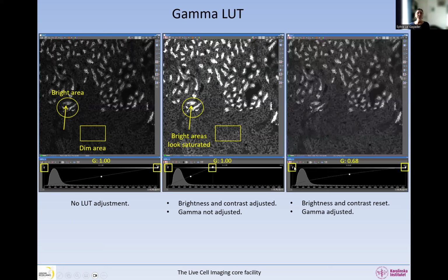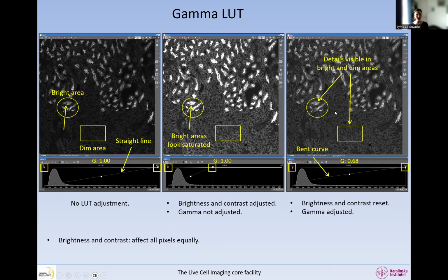So instead, we use the full range of the bit depth, and we change the gamma. It's a little bit difficult to see, but this is not a straight line anymore. It's actually a curve. So when we move the gamma up and down, we are changing the display only for the dim pixels and not for the bright pixels. The bright pixels will still look like they were, but the dim pixels will look brighter. You can see this curve is a little bit bent, whereas here we have a straight line. So here we have a linear gamma, whereas here it is not linear anymore. This is a very good way to display bright and dim areas in the same image without showing the bright areas saturated.